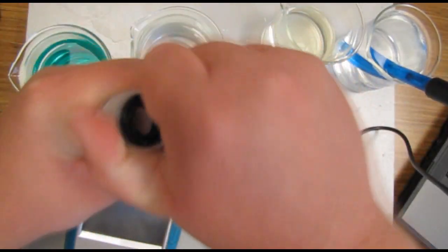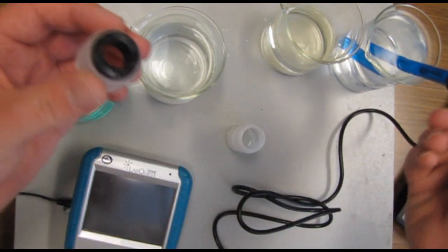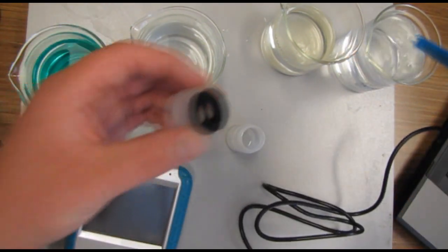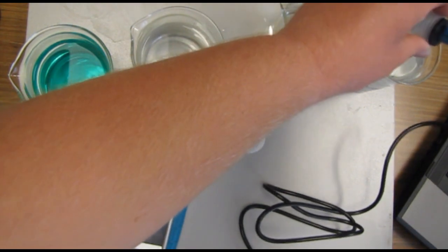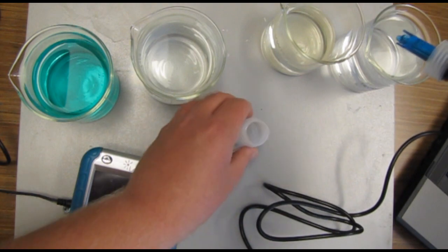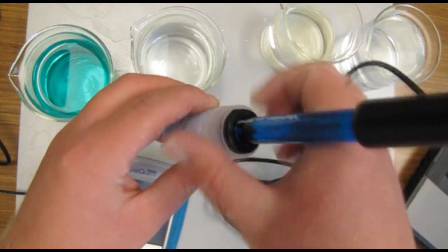Okay, I'm going to open the lid again with the bottle sitting on the counter. Shake off some of the water, whatever you can get off. Slide the lid back on. Push it into the bottle and screw it on.